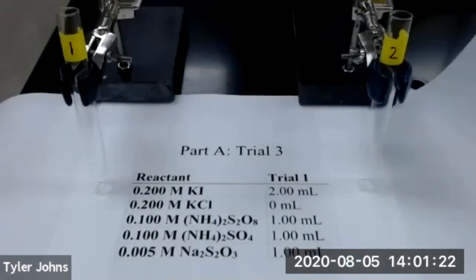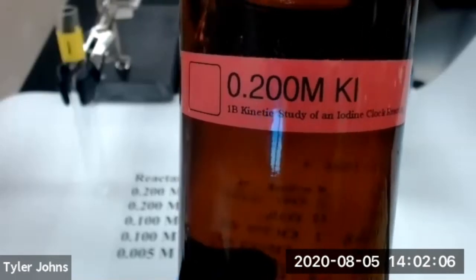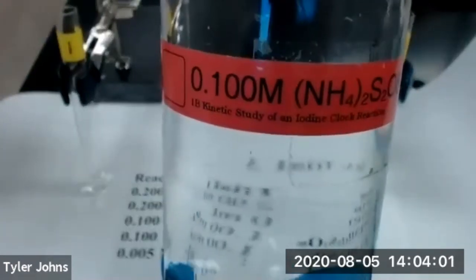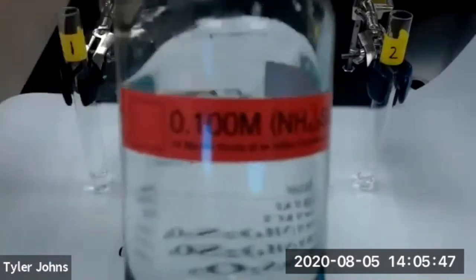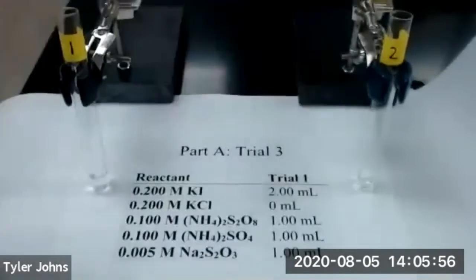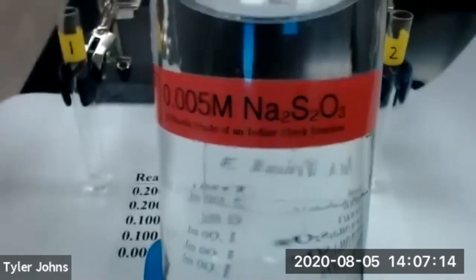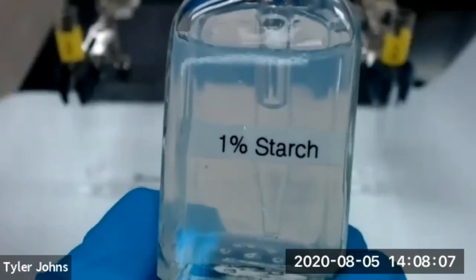We'll now prepare our test tubes for trial number three. We'll first add 2.00 milliliters of 0.200 molar potassium iodide to test tube number one. We'll next add 1.00 milliliters of 0.100 molar ammonium persulfate to test tube number two. We'll next add 1.00 milliliters of sodium thiosulfate to test tube number one. We'll now add 2 drops of 1% starch indicator to test tube number one.